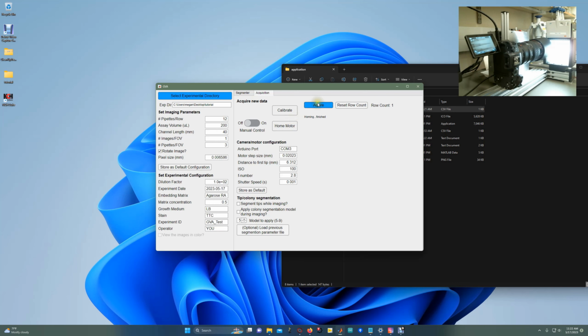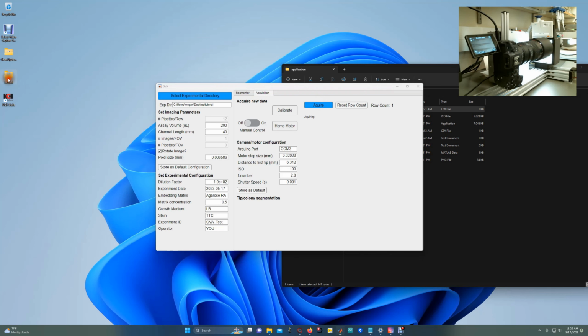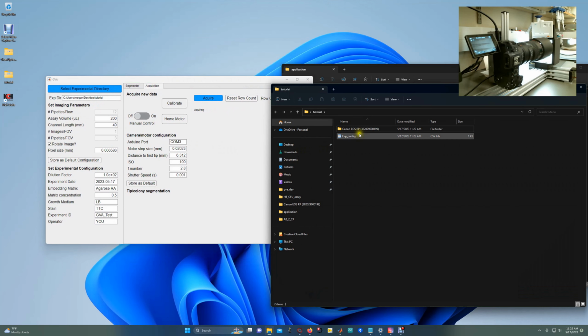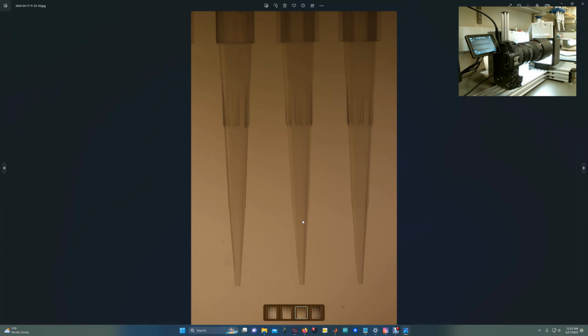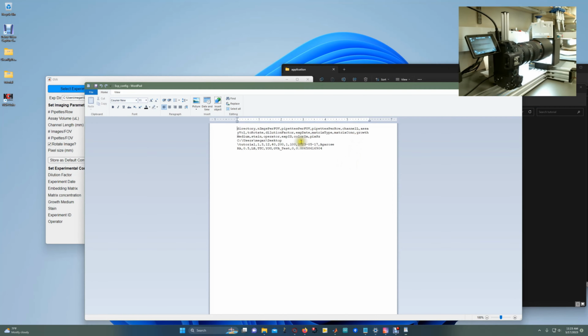So then when I want to acquire, I'm going to click Acquire, and it's going to take 1 picture and then move to the next 3, 1 picture, and so on. And those images are now stored in this tutorial folder. And the name of the folder is this Canon camera. So these are the pipette tips I'm actually taking pictures of. These don't have any colonies in them, just examples. And I also wrote that experimental configuration file.